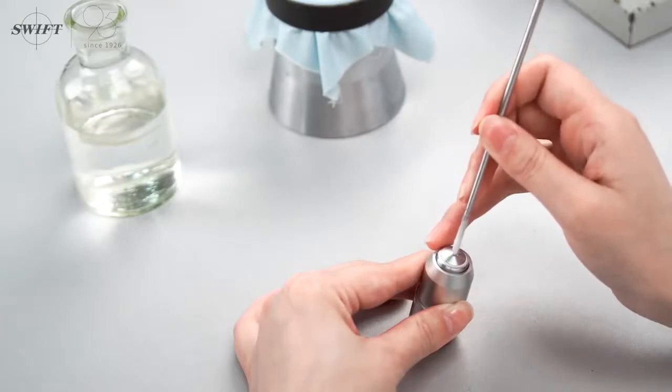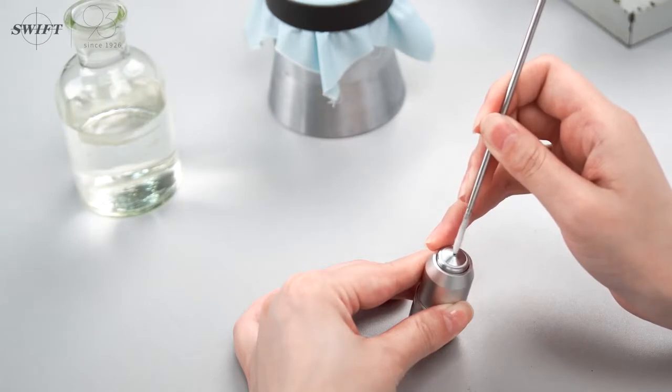Oil immersion objective lens should be cleaned up in time after use, including the observed slides, so as to avoid dirt affecting the future observation effect.